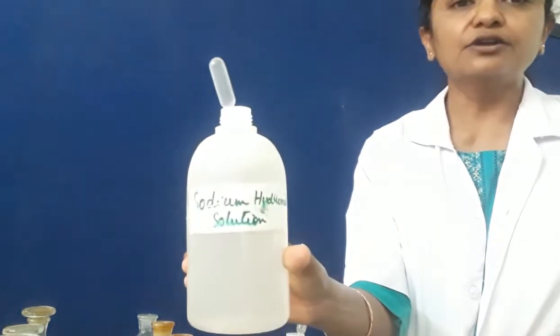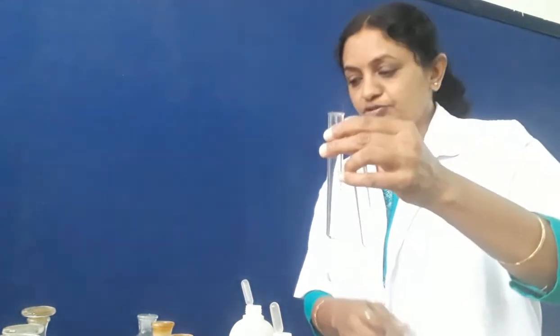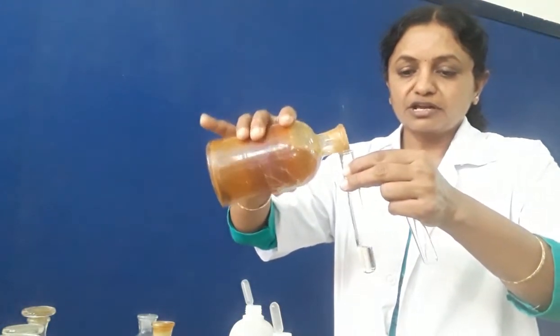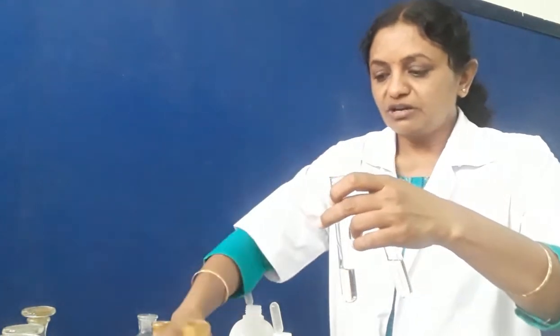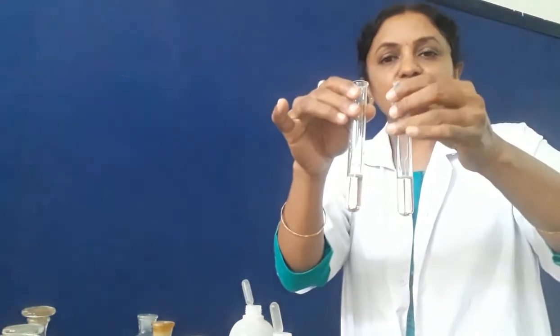For that we need two reagents: one is sodium hydroxide solution and another is ammonium hydroxide solution. So what we have to do is take two test tubes. In both test tubes we will take ferrous sulfate solution, which is light green in color. In one test tube we will add NaOH and in the other test tube we will add NH4OH.